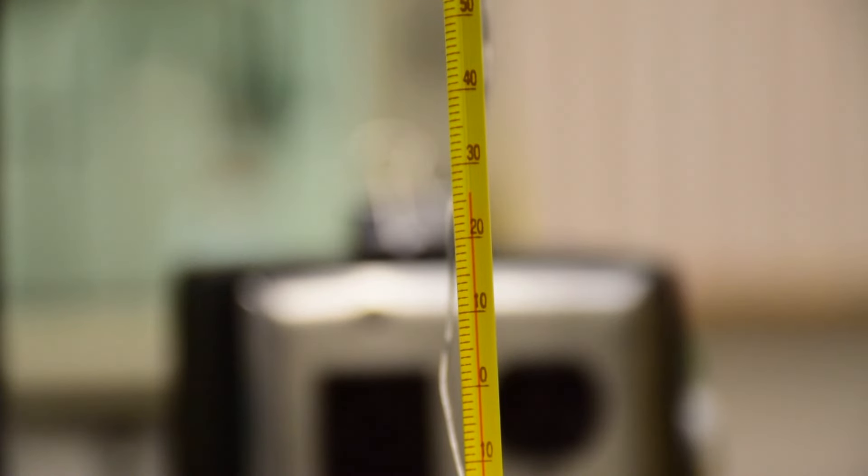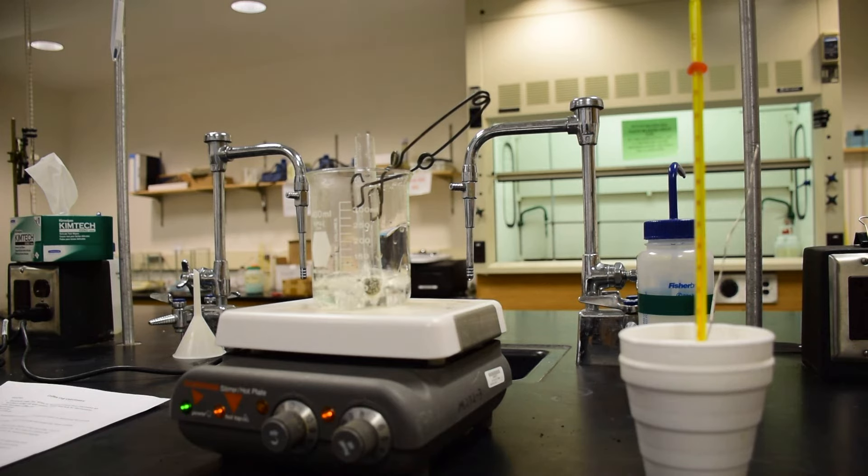Wait until the water in the coffee cup calorimeter reaches a constant temperature and record the temperature. Make sure you keep the metal sample close to the coffee cup calorimeter when you are ready to transfer.